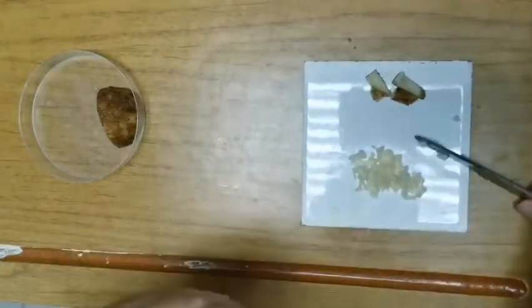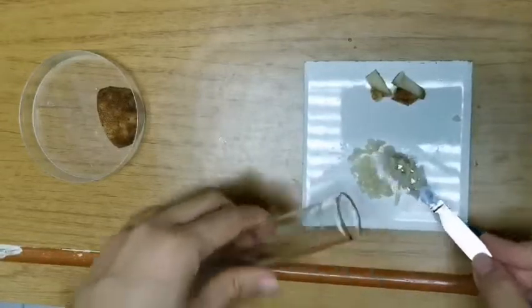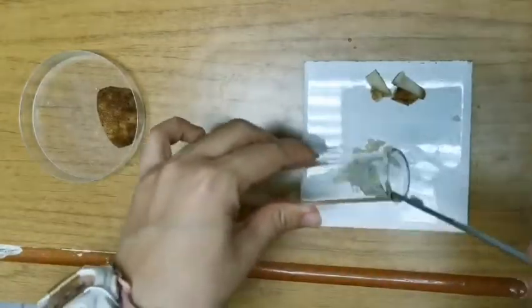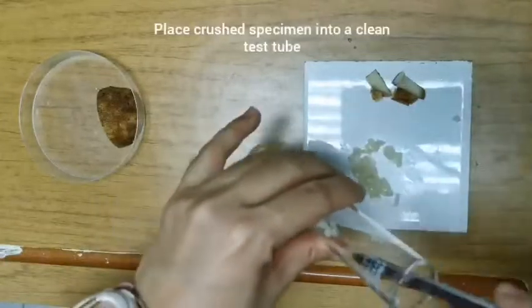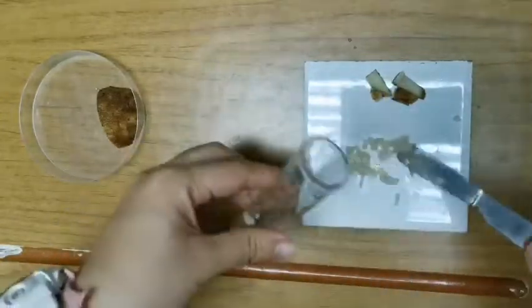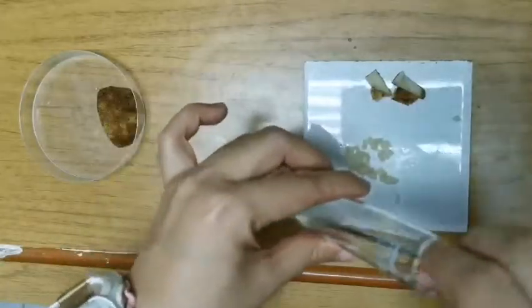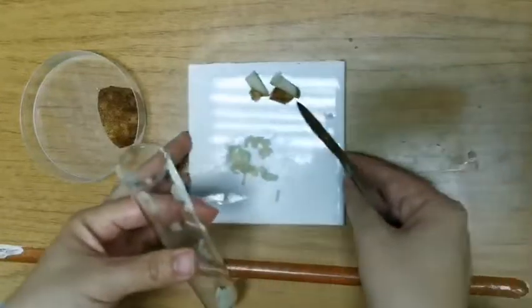Next, what do we do with these chopped food specimens? We take a bit and place it into a test tube. Here I have a boiling tube, so it's easier. It depends on what you're given in the exam. You don't have to put everything in, just enough to get you enough nutrients. I'll put this away.